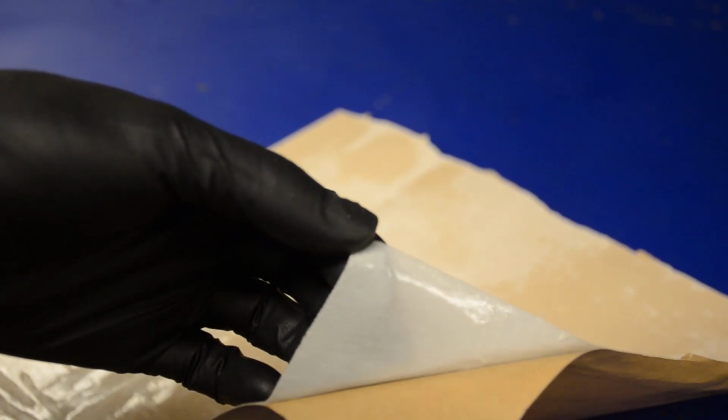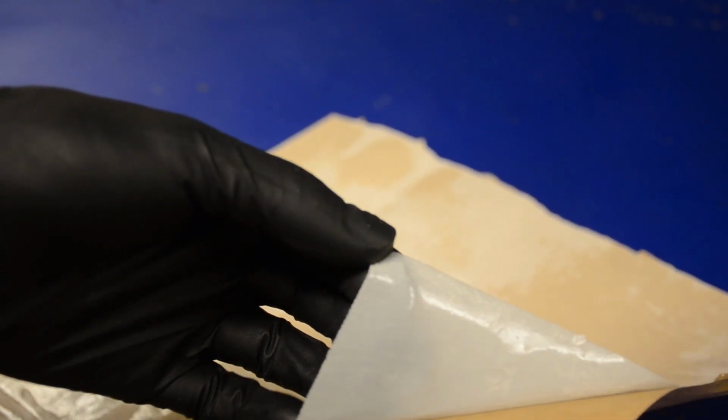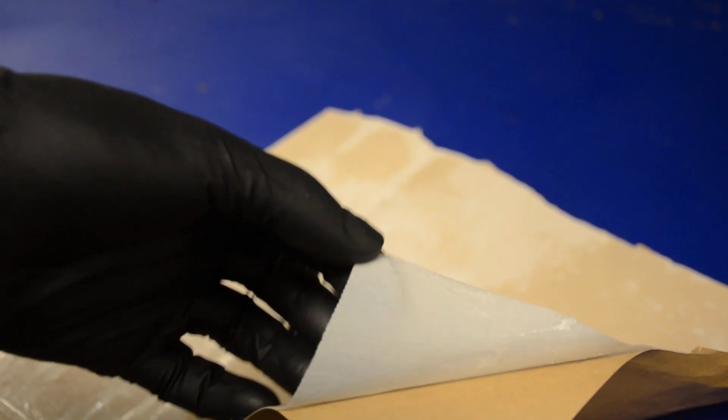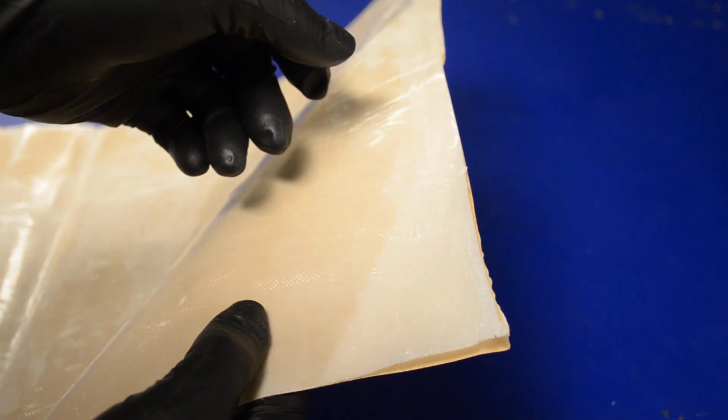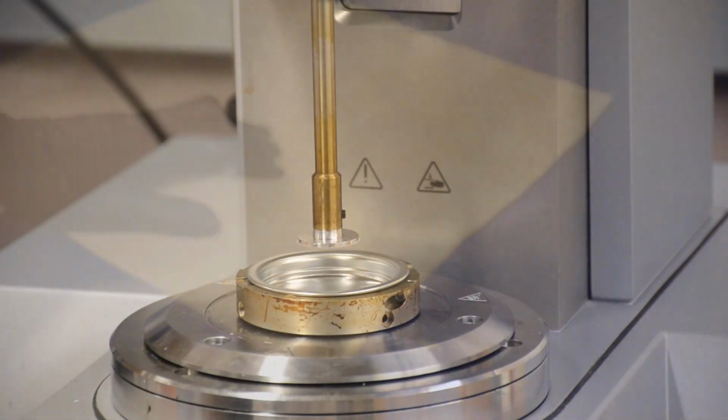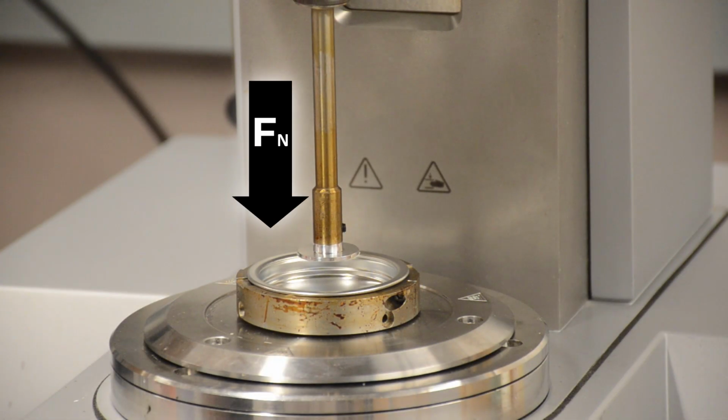This particular resin film has a very high viscosity at room temperature and has a thickness which is not easily changed. We cannot set a gap height of 1 mm between the two parallel plates the way that we did with the previous sample of liquid resin. Instead, we will set a constant normal force for the rheometer to maintain.